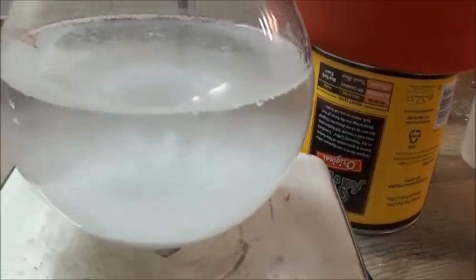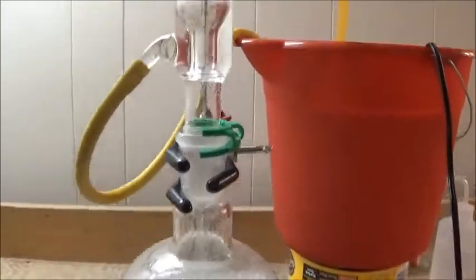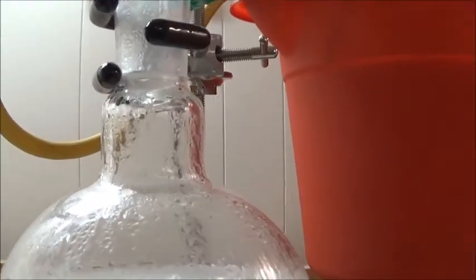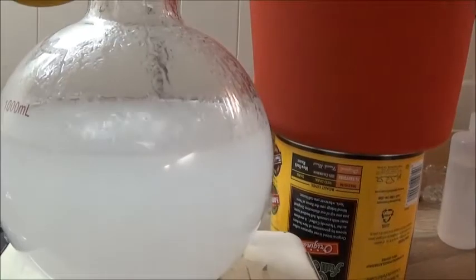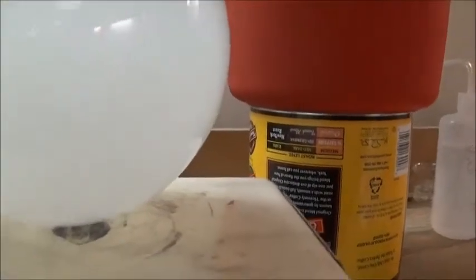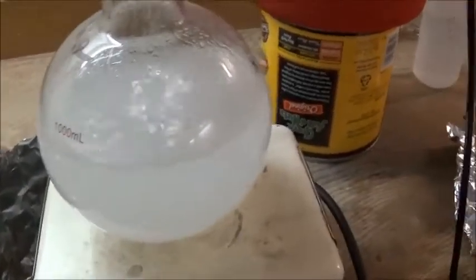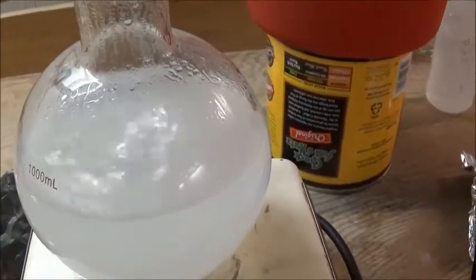And it will start heating as well. We're going to bring it to a boil and reflux it. After a long time heating — because I should have used an oil bath — it's finally started refluxing. You can see it dripping back in. Now we're going to let it reflux for about 25 to 30 minutes, just to let it reach equilibrium. It should be clear because there are no solids anymore — everything's dissolved — but there's a little bit of starch left over from the pills I extracted the aspirin from. It won't cause that much of a problem, but it's still annoying. So we'll just let it go.